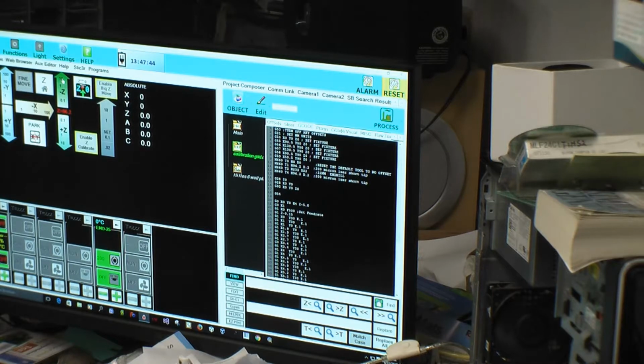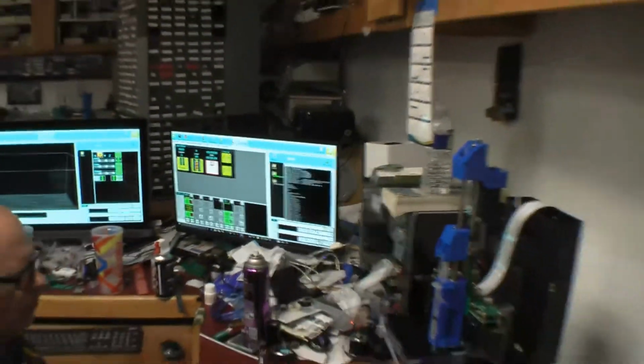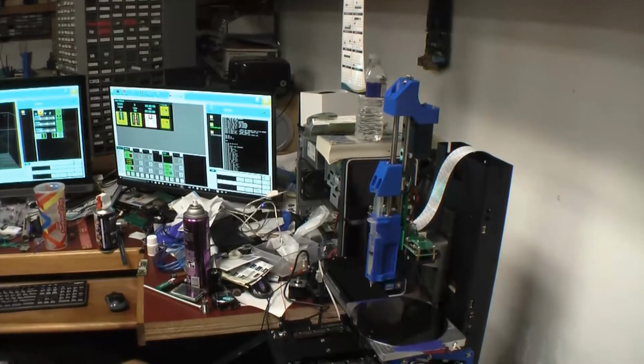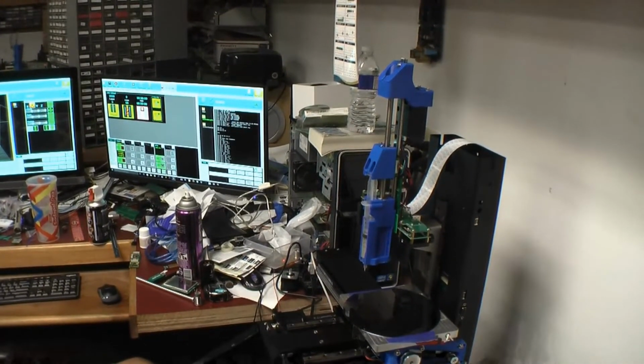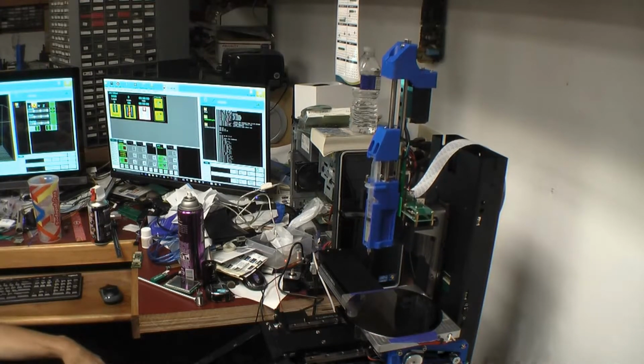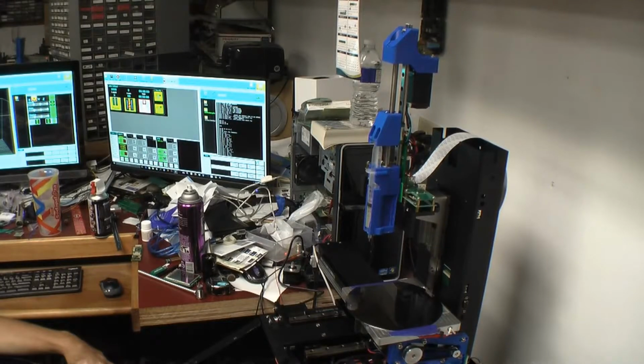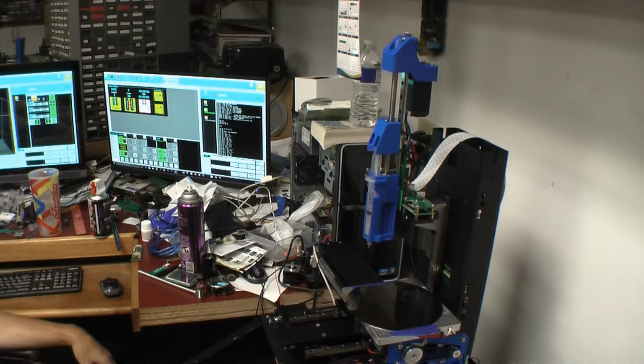Okay, so what I'm going to do is I'm going to move that up. And now this is going to run just like if it was the CNC. So it homes the heads, which is the code I have in there, but I can take that away. And the first head it homes is the Z. You always home your Z first, because if you were down inside of a hole when you canceled a job, you home the other ones, you'll bust off your tool.